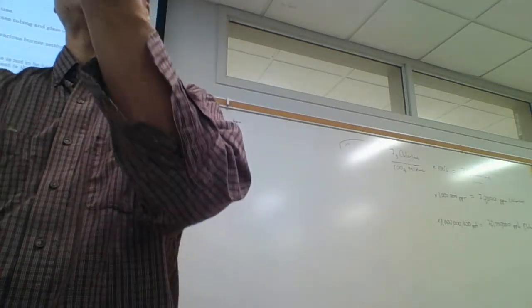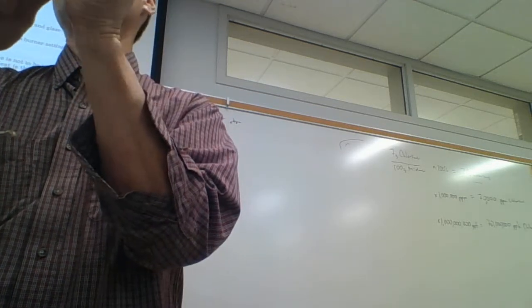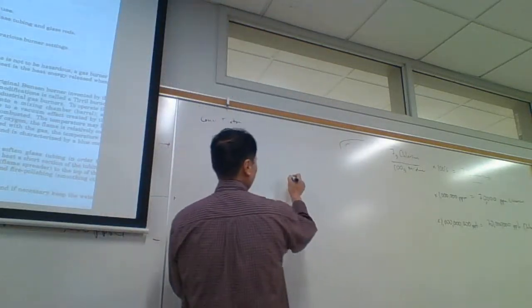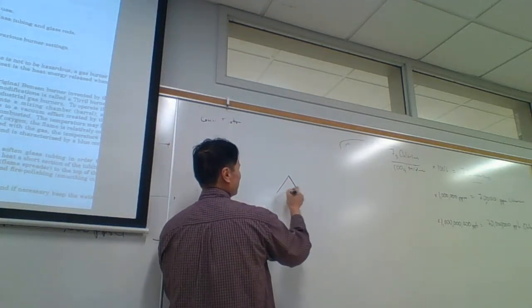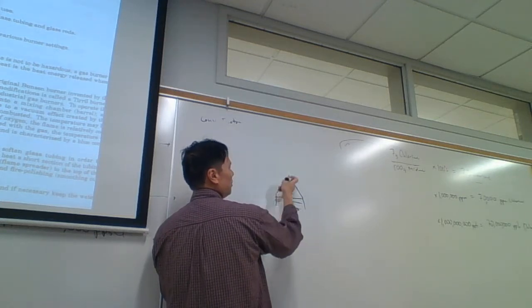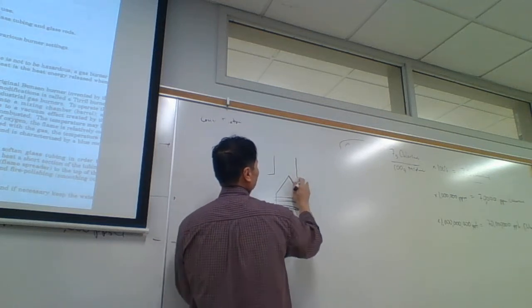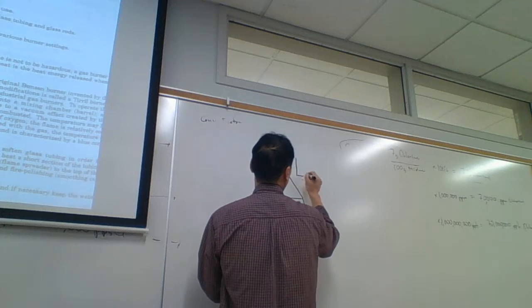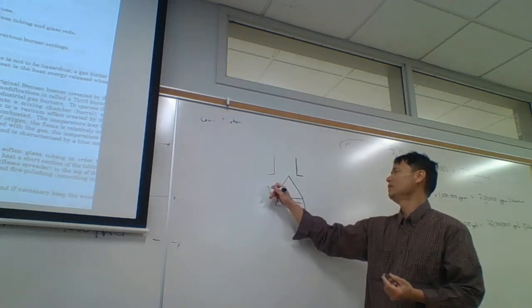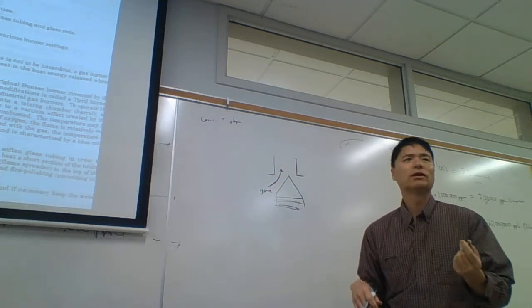Okay, do you guys see the end of it, the tip of it? Did everybody manage to get it out? Yeah. All right, this is called a needle valve here, and it goes like this. It should form a perfect cone there, and then it goes into a seat here, like this. And it's for metering the gas here. It's for fine-tuning the gas flow.